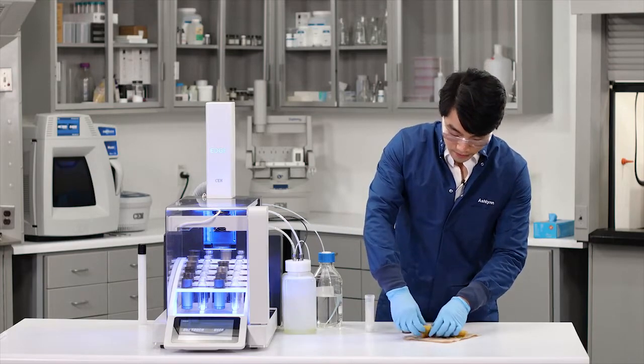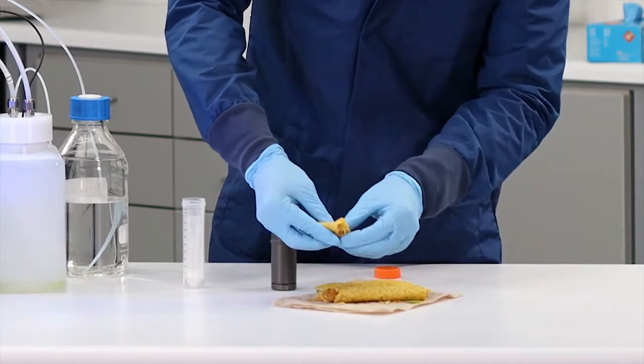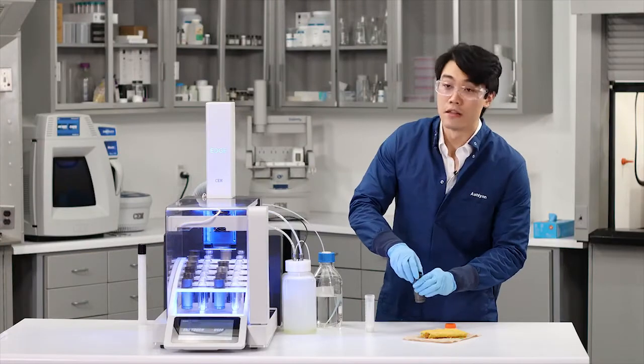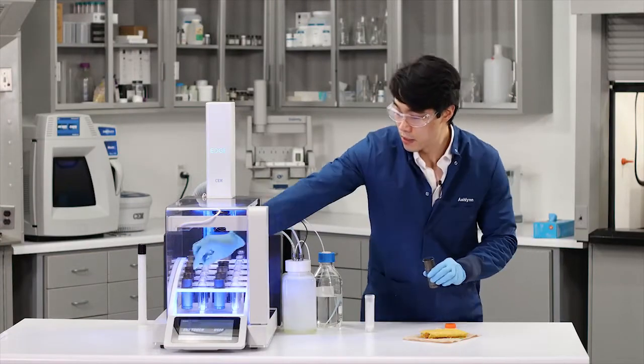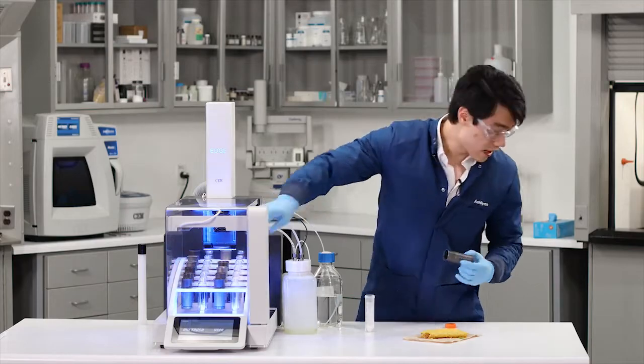Now I'm going to add a little bite, just a tiny one for you Edge, and place this guy directly into the Q cup right there. I'm going to go ahead and load it right into the Edge.